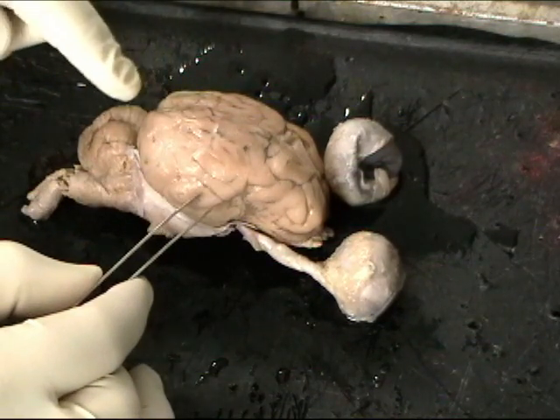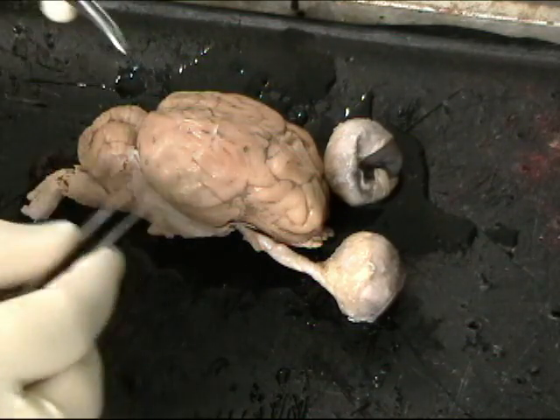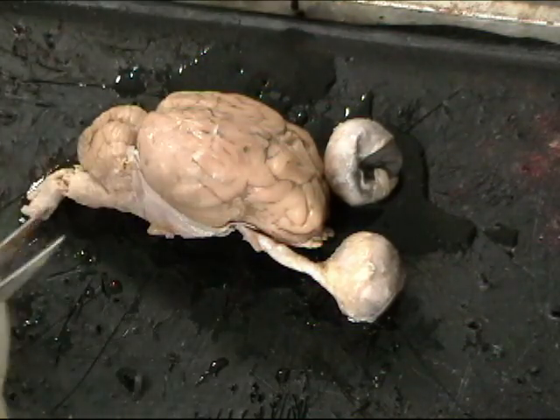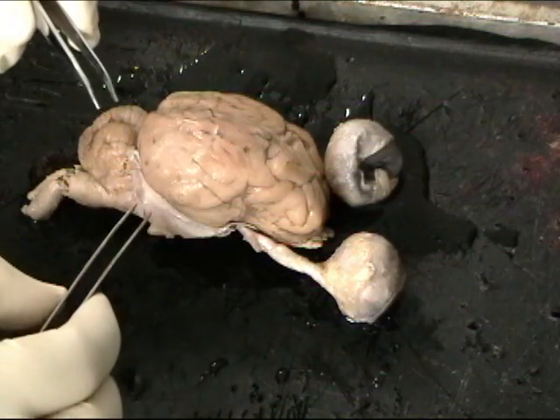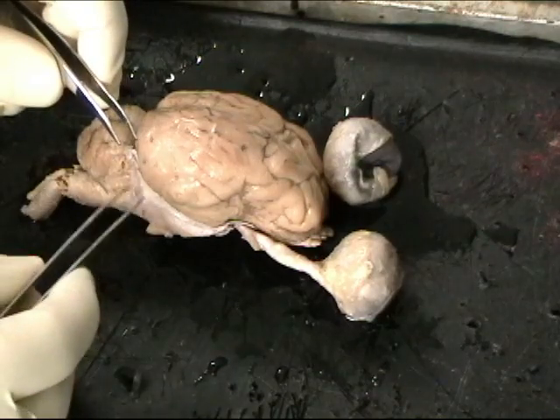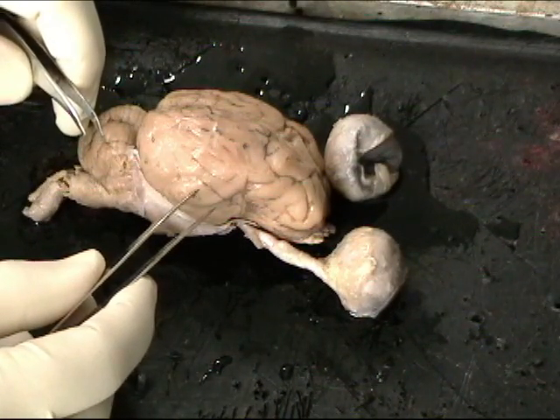It's called Wernicke's area. People who suffer from epilepsy often have damaged tissue in the temporal lobes, and so neurosurgeons will try to cut out that damaged tissue as treatment for epilepsy.